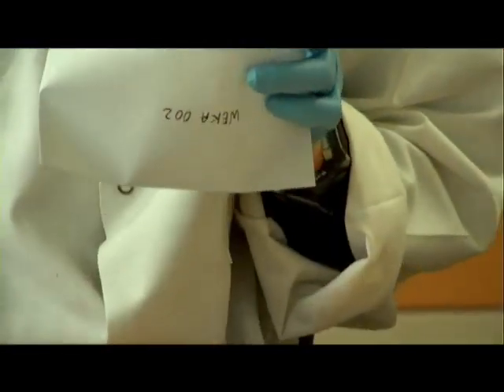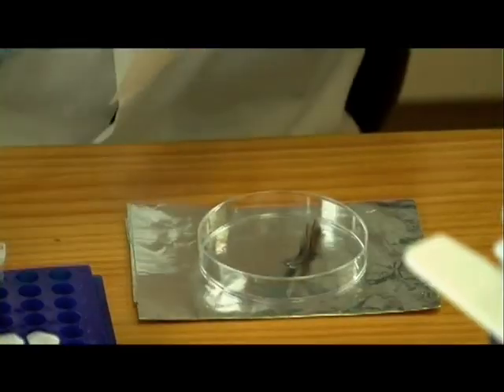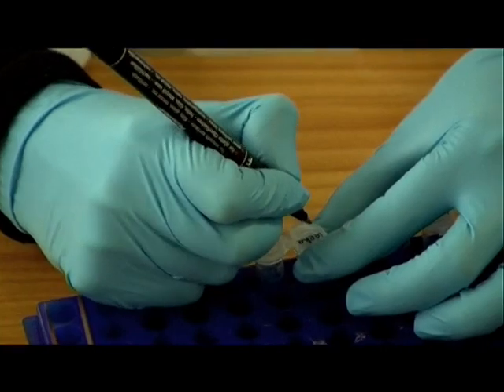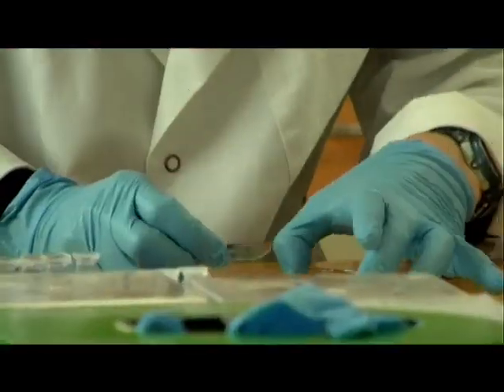DNA can be extracted from almost any plant or animal tissue. The best extractions come from fresh material, but DNA has been extracted from tissue as old as 100,000 years. There are many methods for DNA extraction. We will use a commercially available extraction kit, as this is the most straightforward and easy method. We are going to extract DNA from a weka feather. When the feather is pulled out, a very small piece of tissue comes out in the end of the feather shaft, and this is enough to extract DNA, which will be good for PCR.